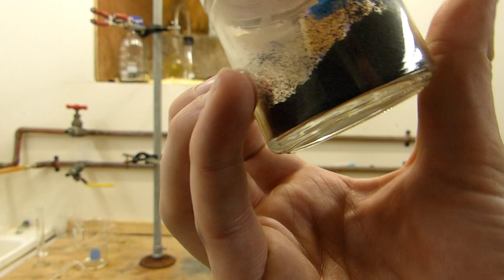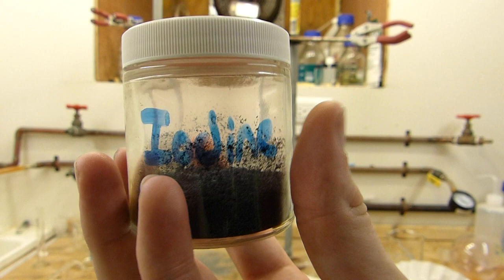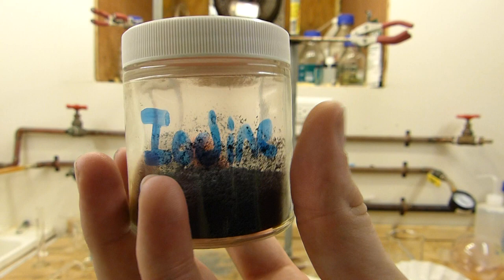And here we have a jar of iodine. Slightly damp, but not so damp that it doesn't form a nice flowing powder. And it's ready for future use and possibly purification depending on the type of reaction.